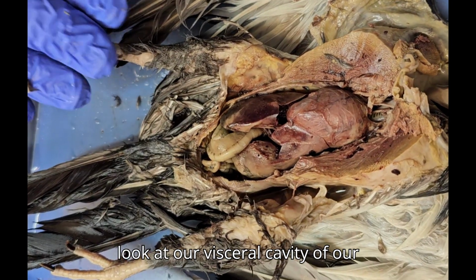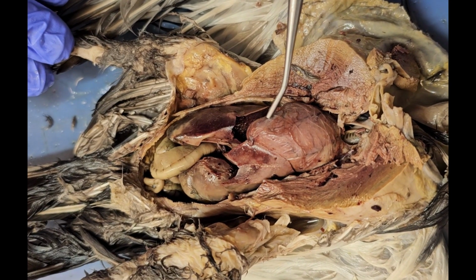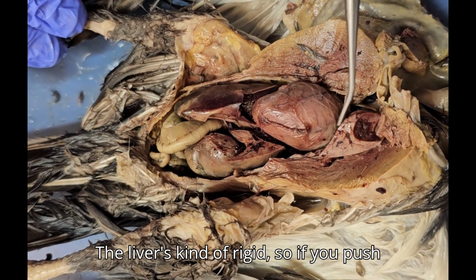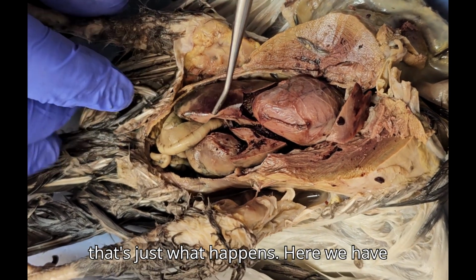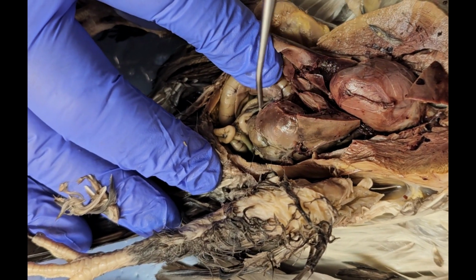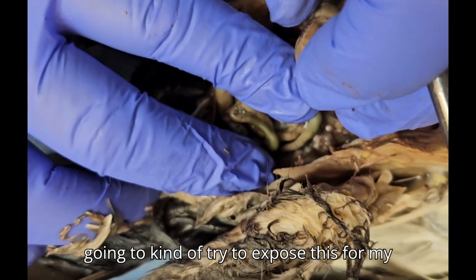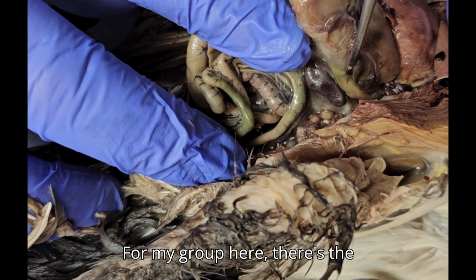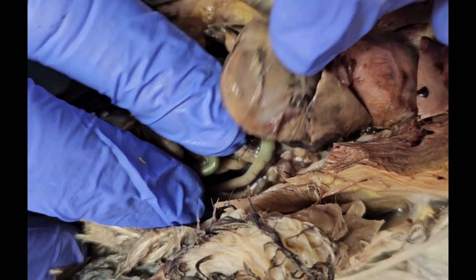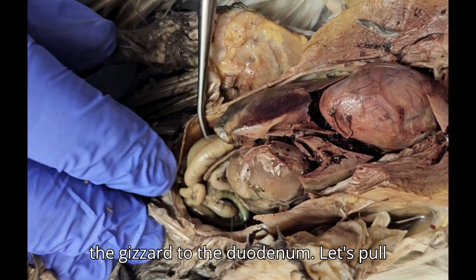Now let's take a look at the visceral cavity of our pigeon. This is the heart. And then we have multiple lobes of the liver. The liver is kind of rigid, so if you push it out of the way and it gets broken, that's just what happens. Here we have the gizzard. Now if I pull the gizzard forward, I'm going to try to expose this for my group here. There's the proventriculus. All right. And so we're going proventriculus to gizzard, and then from the gizzard to the duodenum.